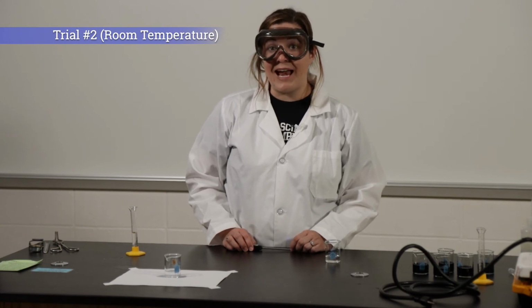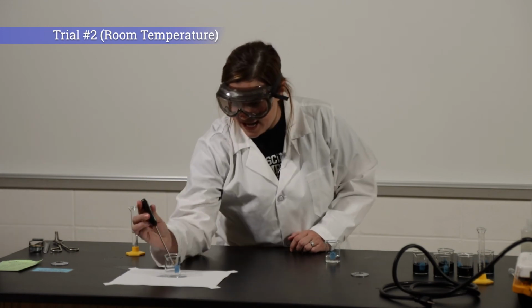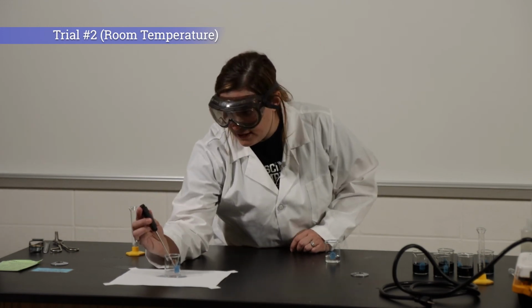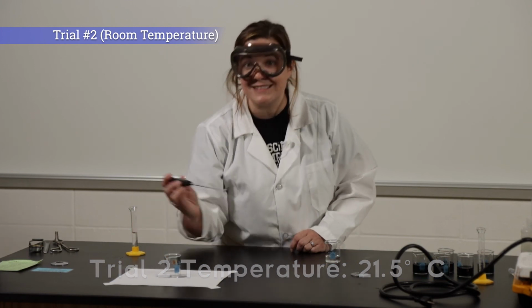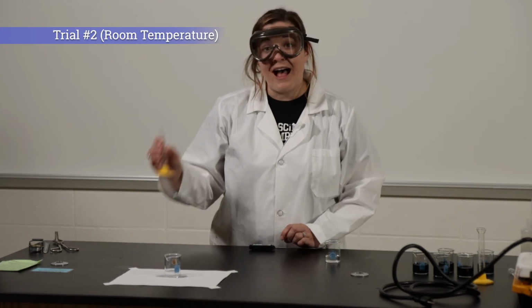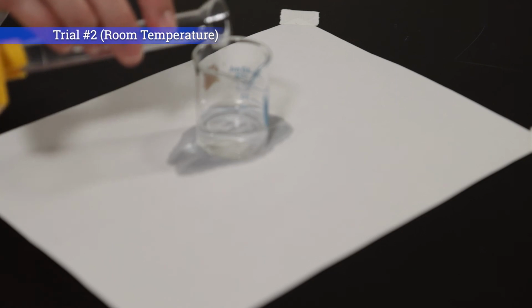For trial 2, we're going to do the same reaction, but we're going to do it at room temperature. So again, I'll start by taking the temperature of solution A, 21.5 degrees Celsius. I'll add solution B, and again, record the time that it takes for the solution to turn dark blue.